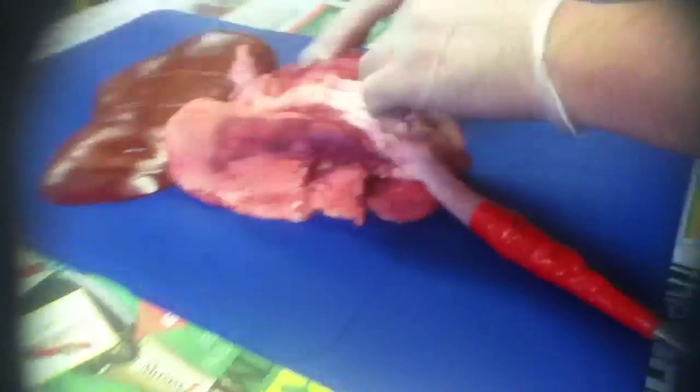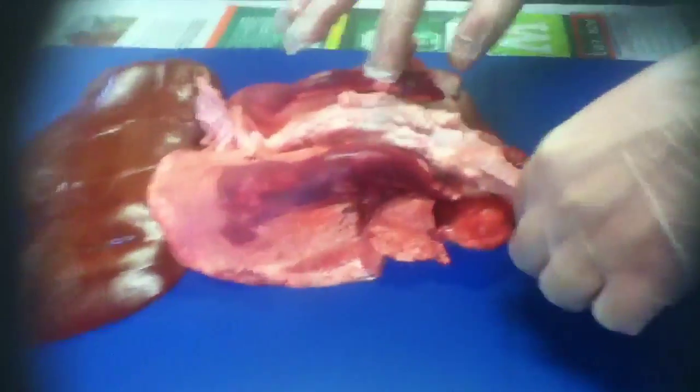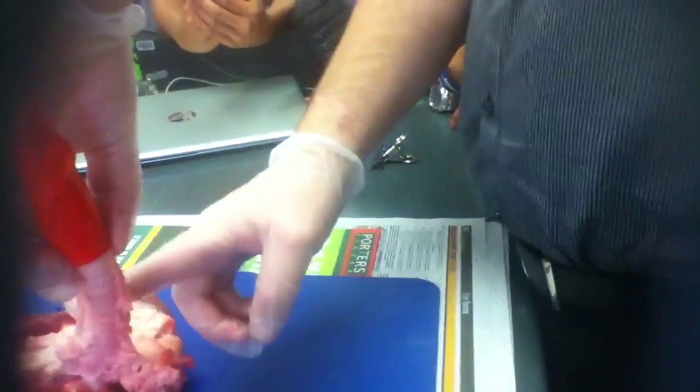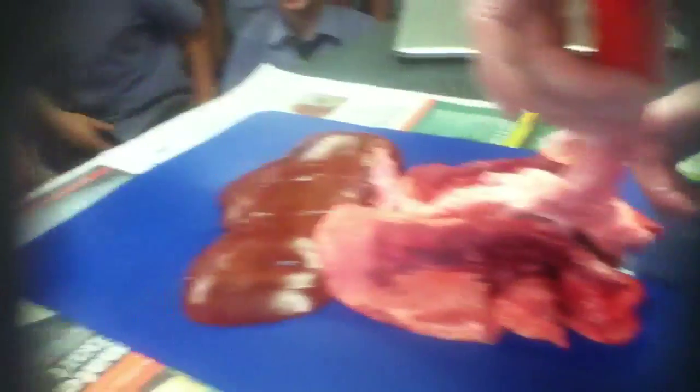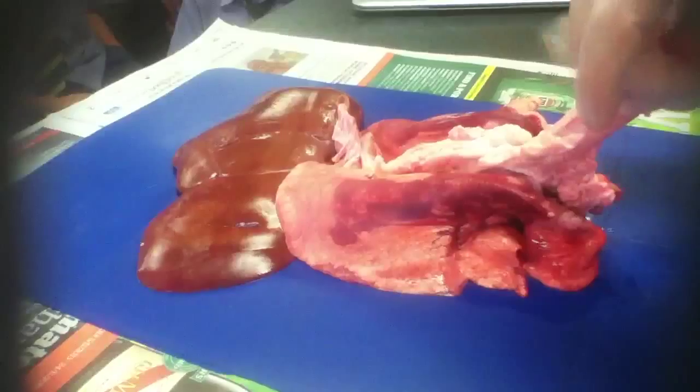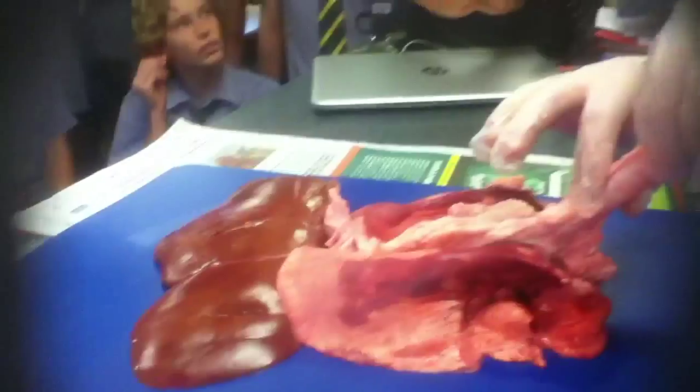That's a good picture. Now moving up, moving up guys — what would this bit be? The vertebrae? The trachea. Now, the trachea is really interesting, it's actually made up of cartilage, so it's the same as the cartilage in your ear and your nose.